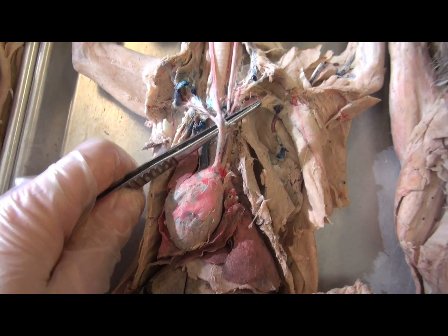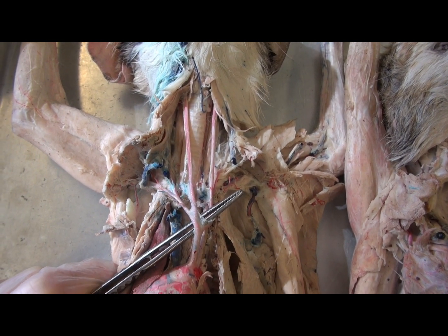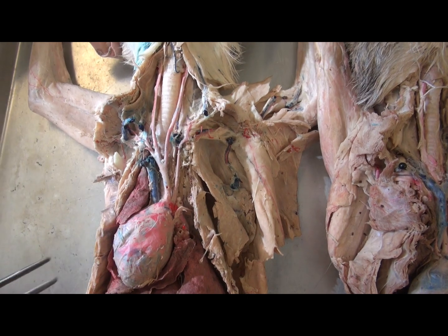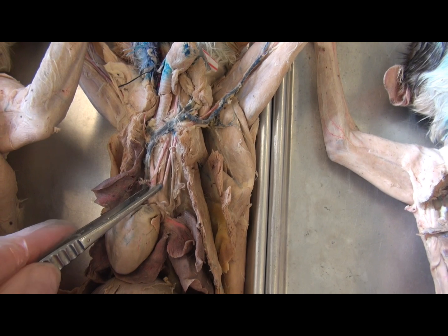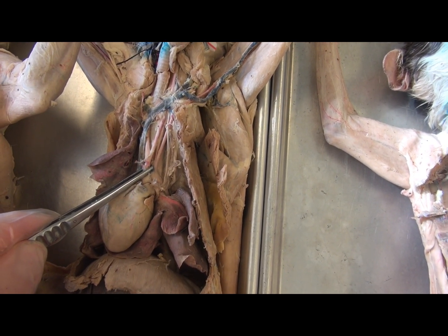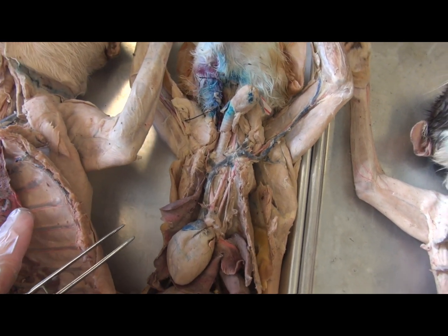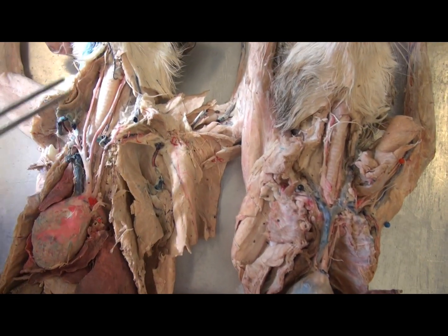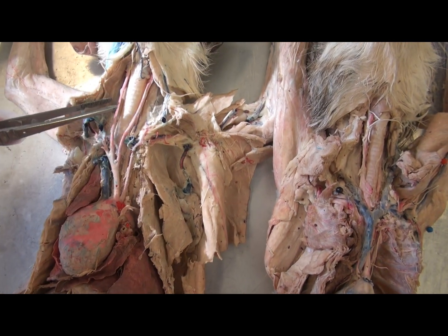In humans, the brachiocephalic trunk forms the right common carotid and the right subclavian, but the left common carotid comes directly off the arch of the aorta. So in cats, there are only two blood vessels leaving the arch of the aorta traveling superiorly: the brachiocephalic trunk on the right side, and the prominent left subclavian going to the arm. In this cat, the veins have been removed so that one can better view the arteries.